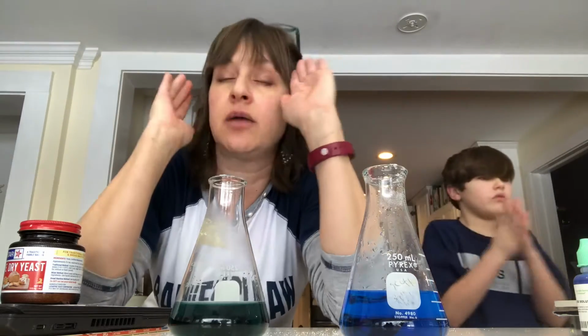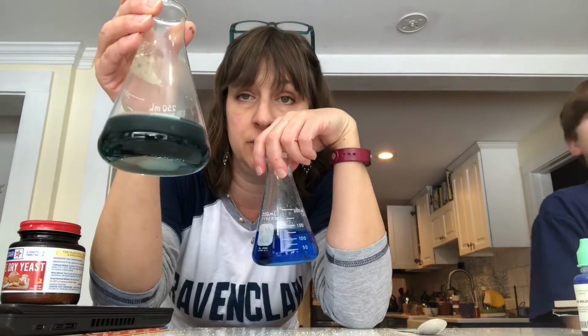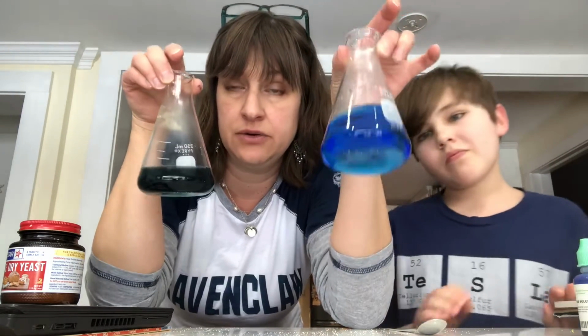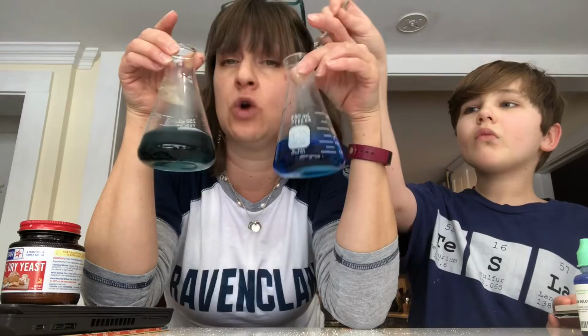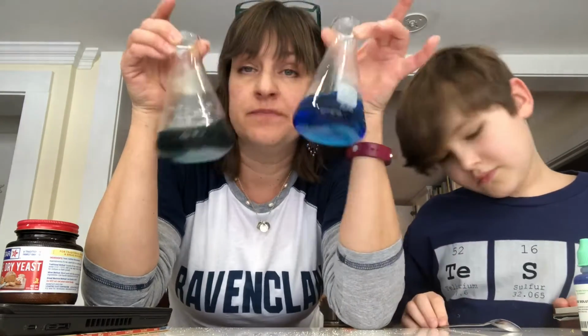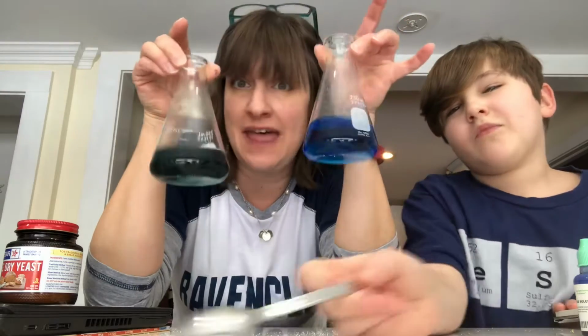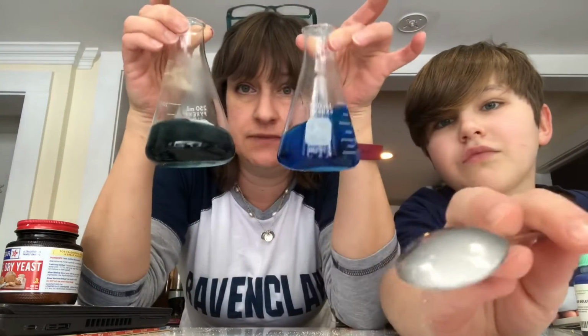If you look at your lab report, you're going to see there is a table, and I have put a place in the table for your before and your after observations. So bromothymol blue, methylene blue. Remember, please, that I hate it when you put one word for an observation. Not yet, please. All right. Be a little more descriptive than that. Blue will be marked incorrect. Okay, so here we go.